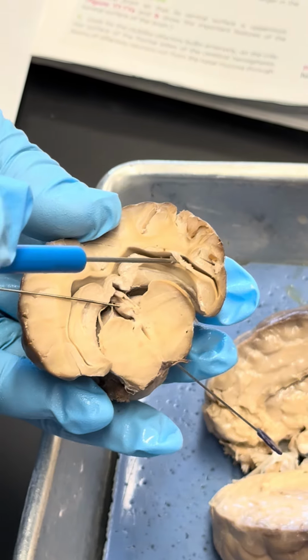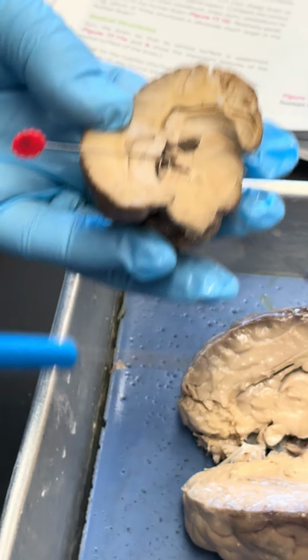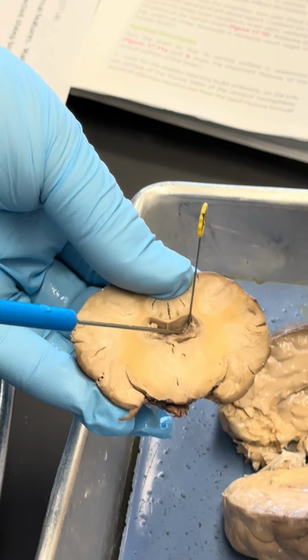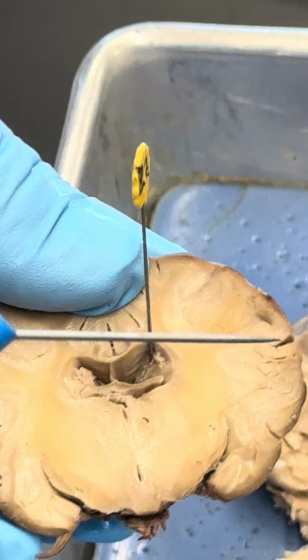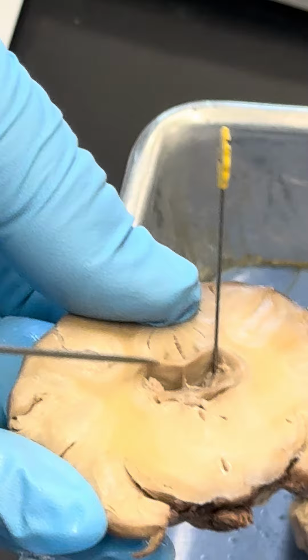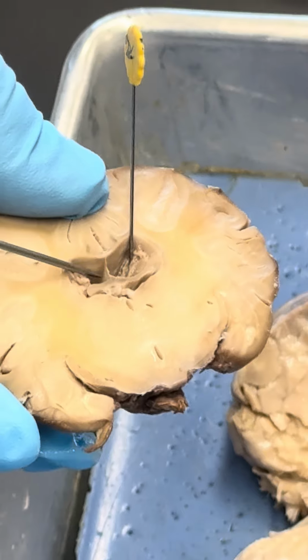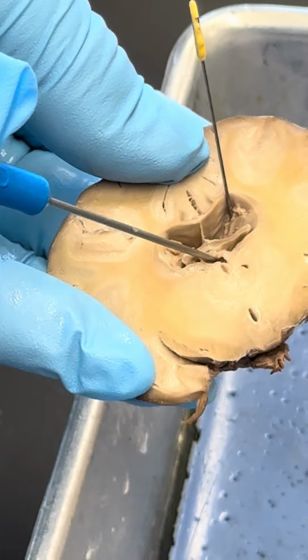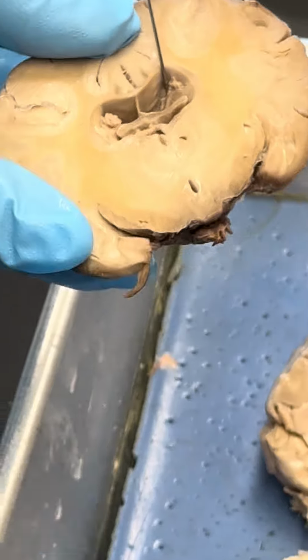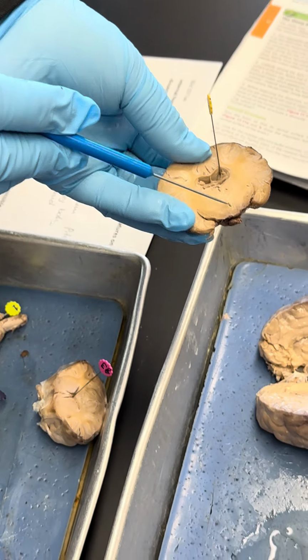Here we see the lateral ventricle and the other lateral ventricle, and have a better view of here. That's again also the lateral ventricles, both of them. And here, what we see here, this is the septum pellucidum that separates the left and right lateral ventricle. So septum pellucidum. Down here, that is the third ventricle, and here we also see the third ventricle. So the third ventricle kind of turns around there. So we have ventricle like 1 and 2, they're both lateral, third ventricle.